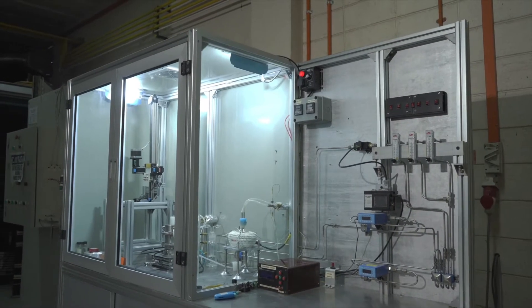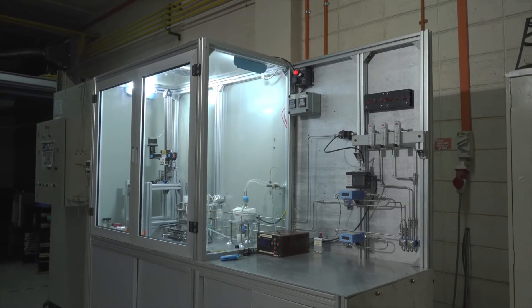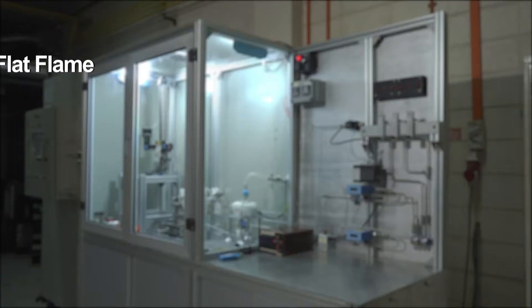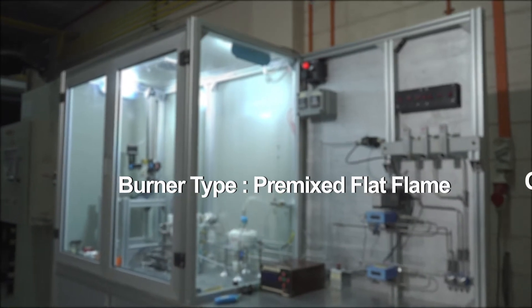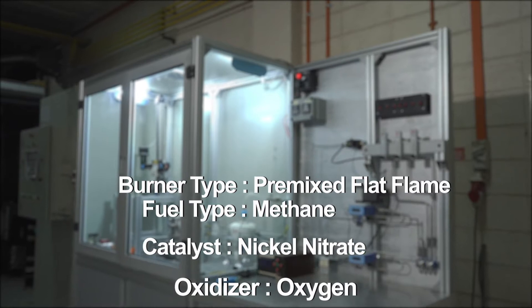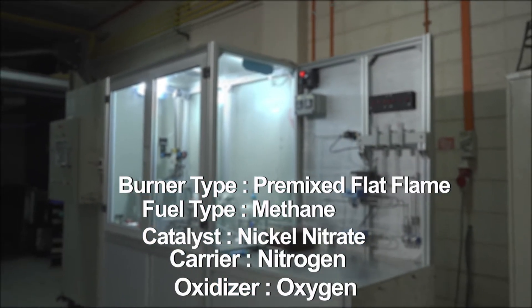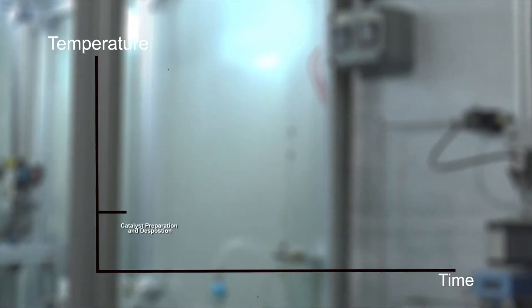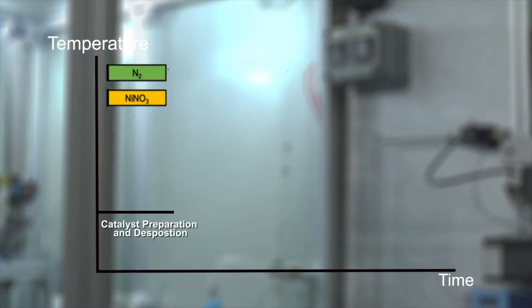The test rig used to develop the synthesis process was designed and fabricated in-house in the high-ref laboratory. The synthesis process utilizes a premixed flat flame with a mixture of methane and oxygen gas. The catalyst is nickel nitrate with nitrogen as carrier gas. The overall synthesis process is designed to be relatively simple: place ceramic beads at the right height above the burner before coating with catalyst vapour.